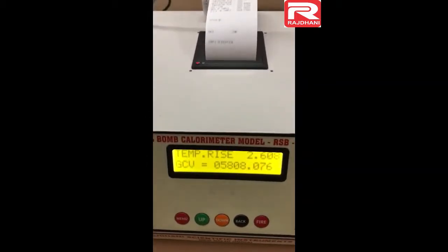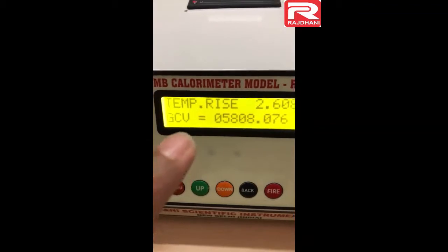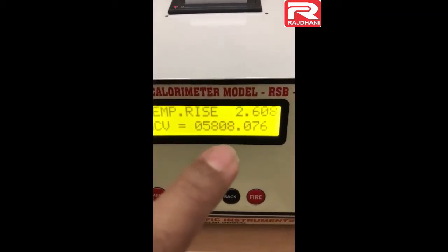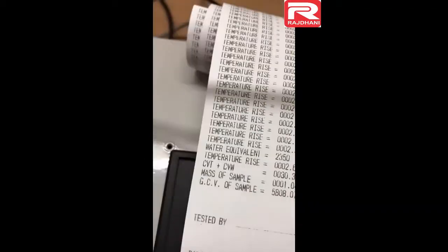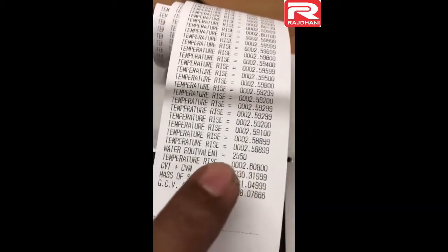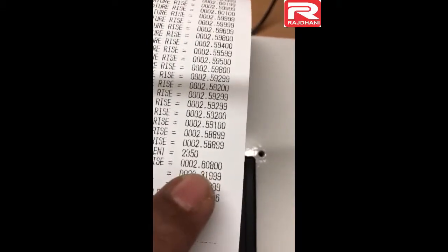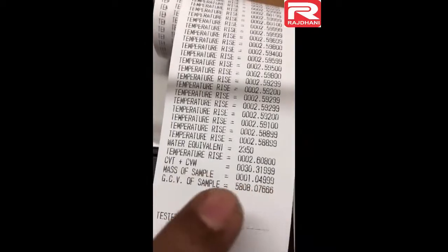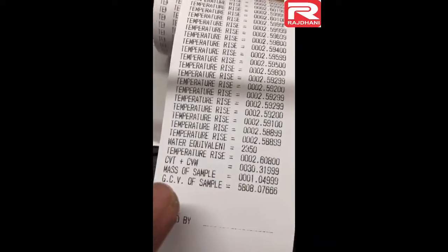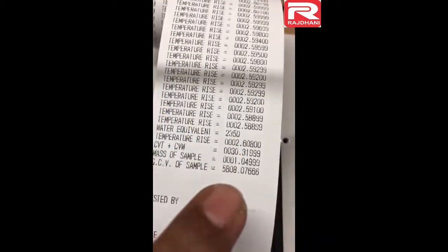Now there is a beep — it is showing temperature rise is 2.608 and GCV value is 5808. The calculation details are displayed: water equivalent was set earlier, temperature rise has taken the highest value 2.608, CVT plus CVW is 30.32, mass of sample is 1.050, and GCV is 5808.